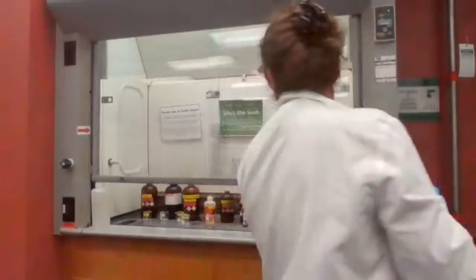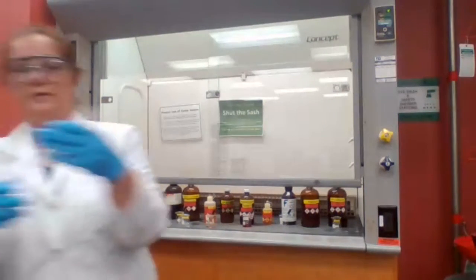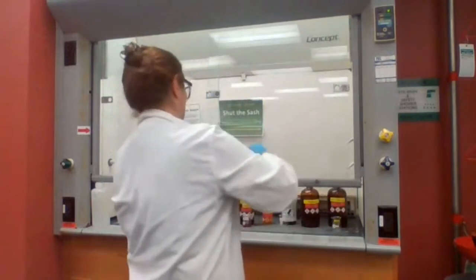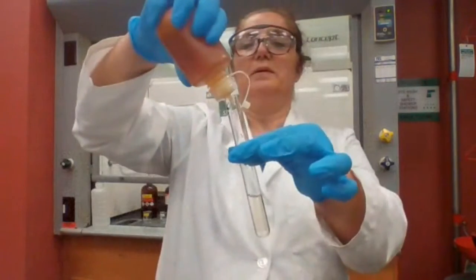Ferric chloride. Okay, we're going to do ferric chloride first. The phenol, and we want to add the ferric chloride.